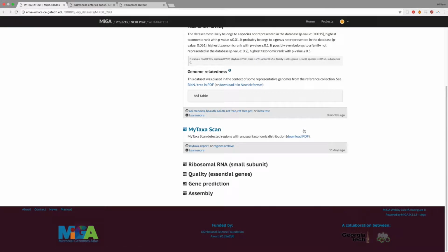When the analysis is finished, a PDF report will be generated which provides information on the distance of each window from the average of the genome and options to check the origin of each window, download the corresponding genes, or other options. Windows that deviate from the genome average may represent cases of recent horizontal gene transfer or contamination.